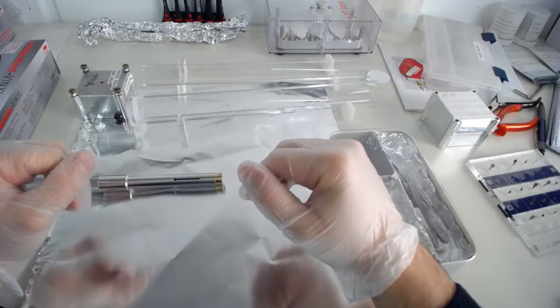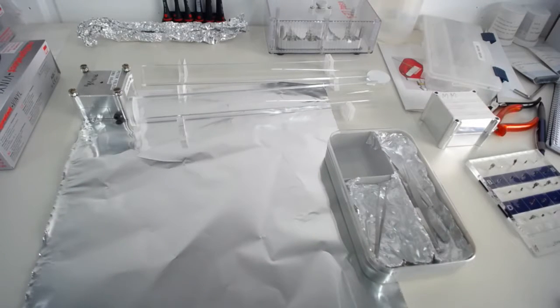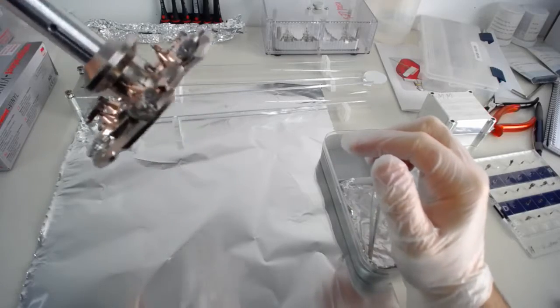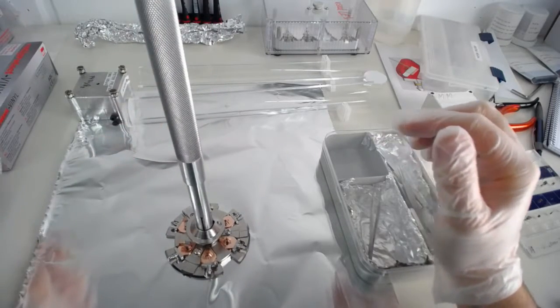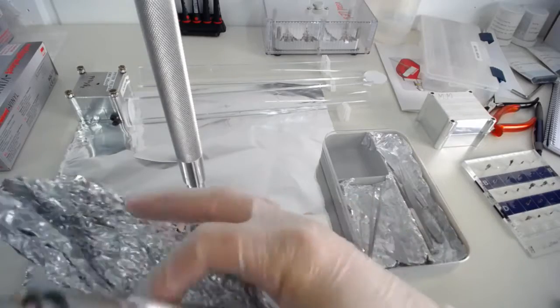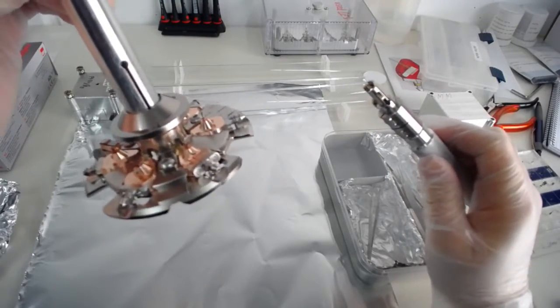We've got a special drying furnace as well where it can dry at 200 degrees or 250 degrees for a little bit of time. And that really makes sure that the gear is all clean when we work with it. So now I'm going to get the samples out of the atom probe. I've already vented the load lock of the atom probe so I can get the samples out. So I'll just grab the rod and get the samples from the atom probe. Okay, I'm back. And so when you get the rod out, you'll see it sticks out at the bottom a little bit, which means it doesn't sit flush. So just press the button, it will sit flush.